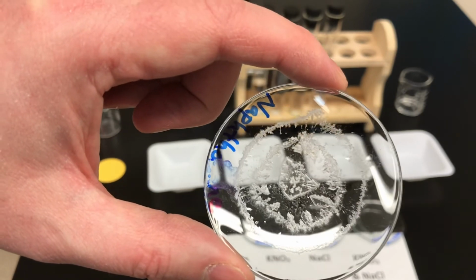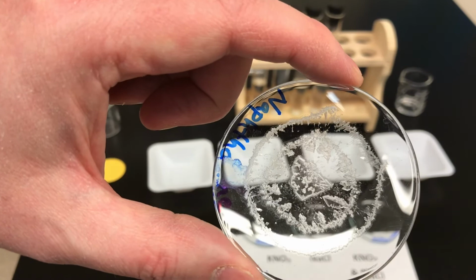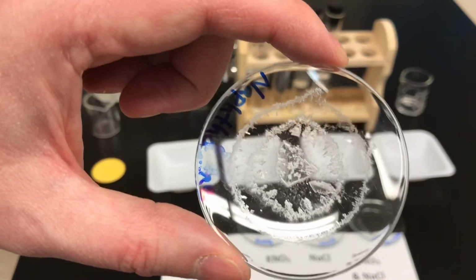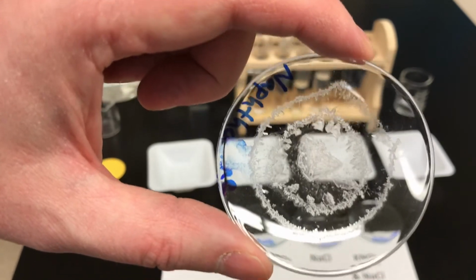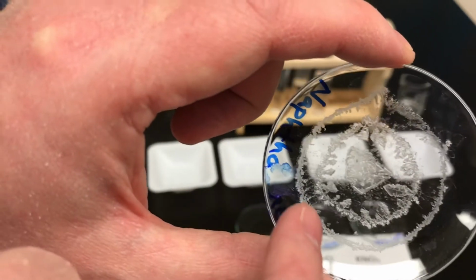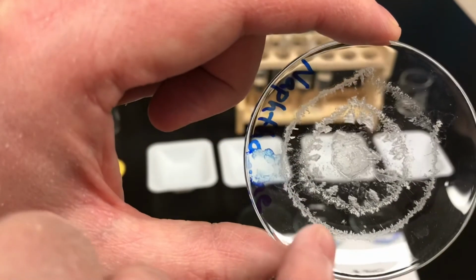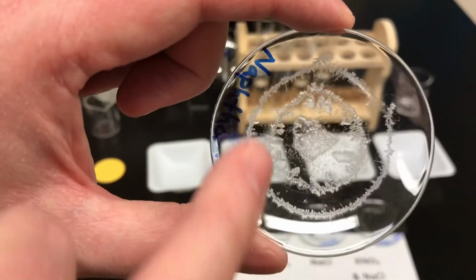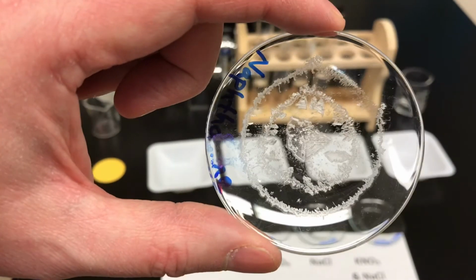Naphthalene basically forms sort of a generalized white crystalline precipitate. Sometimes it has a bit of a pattern to it, but there's really no characteristic shape. There's maybe a little tiny bit of needling along the sides there. I don't know if you can see that, but not really anything that's easily described.